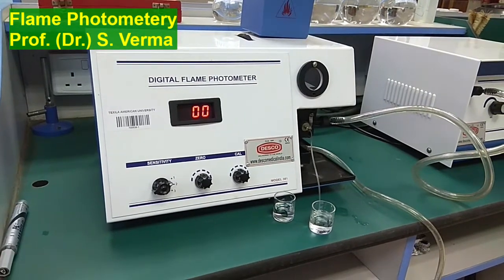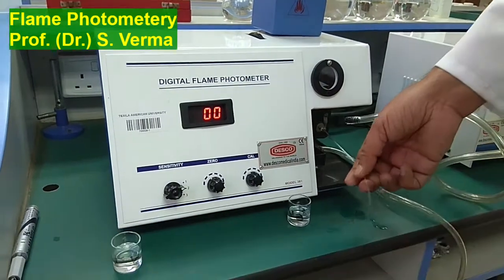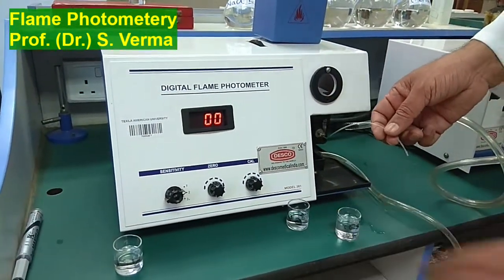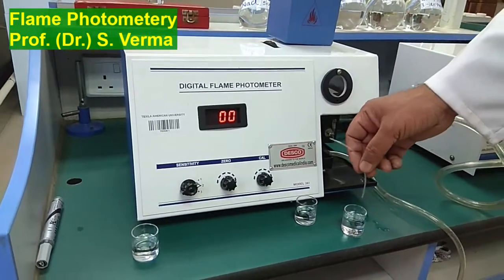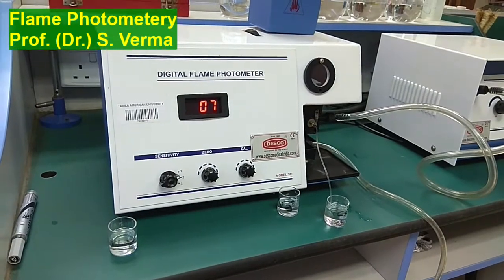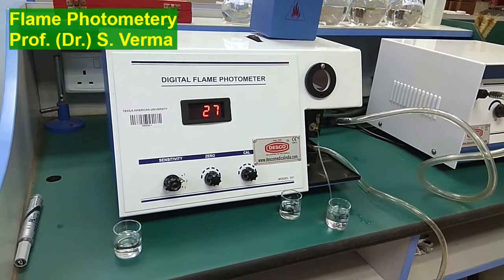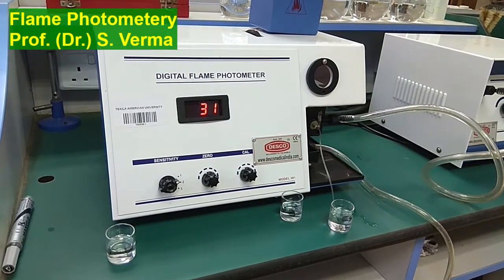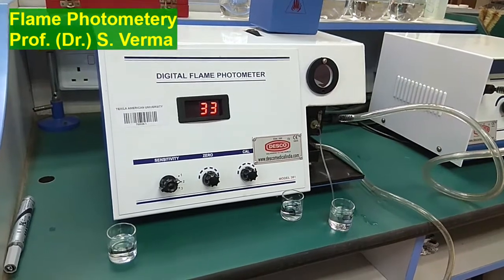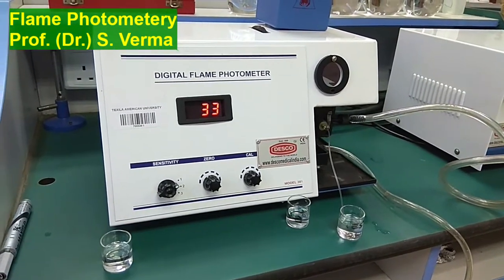Okay, so it's back at 0. So that means I'm ready to find out the concentration in my test solution. This is my test solution wherein I need to find out the concentration of sodium ion. I'm dipping this capillary again, now this time in test solution, and this should give me my result, which is 33 ppm.